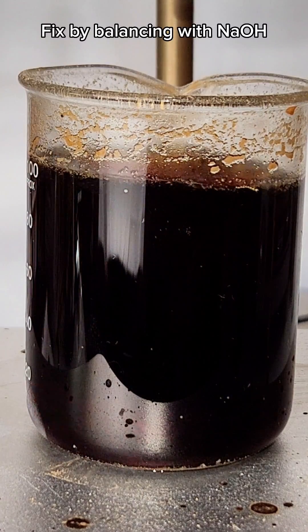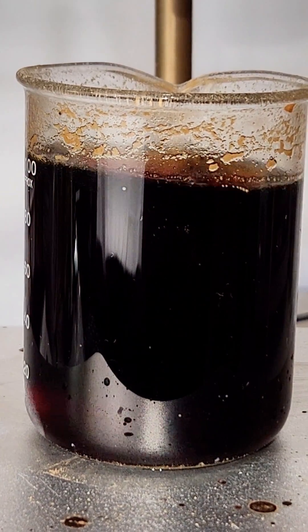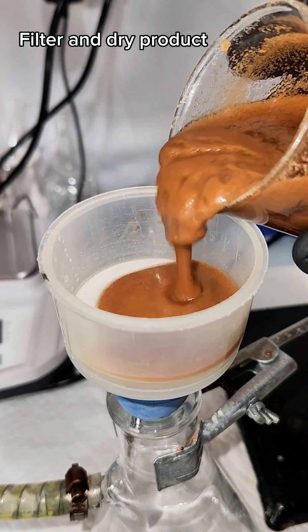Now for my final step I want to filter and dry my crude anthranilic acid. You can also do a recrystallization in ethanol for really high purity but I didn't bother because it's not really relevant for my applications.